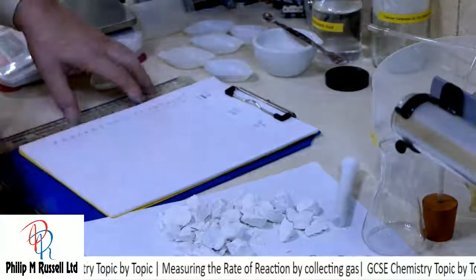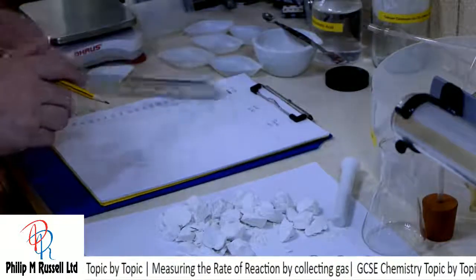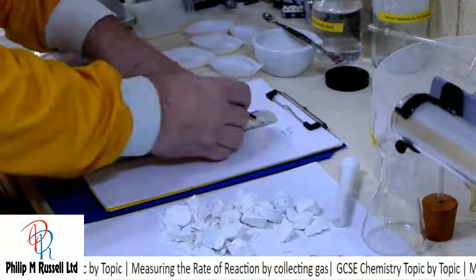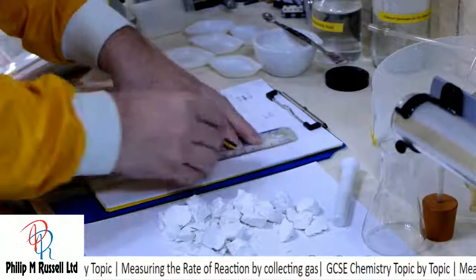And we'll run this for about 90 seconds. So I've got my large, I've got my small, and we've got the powder.